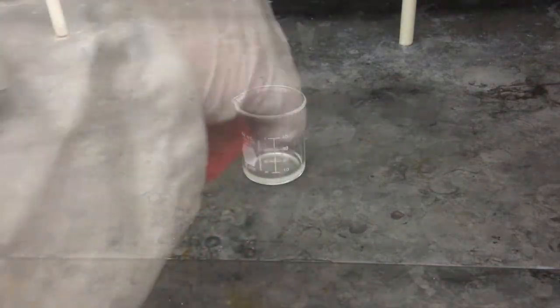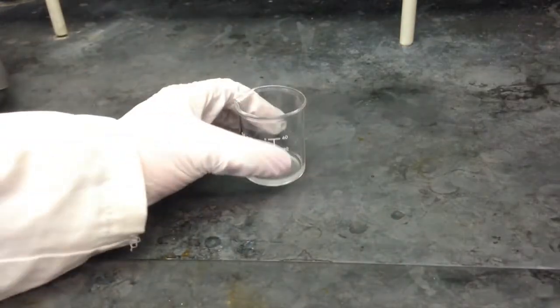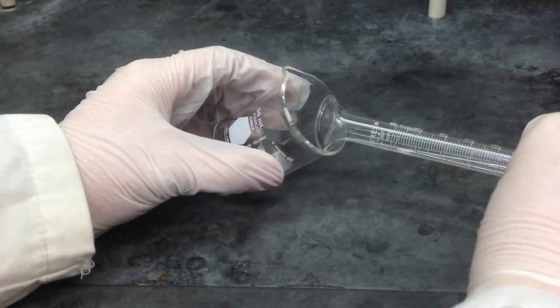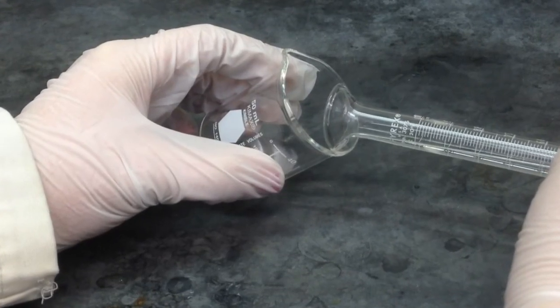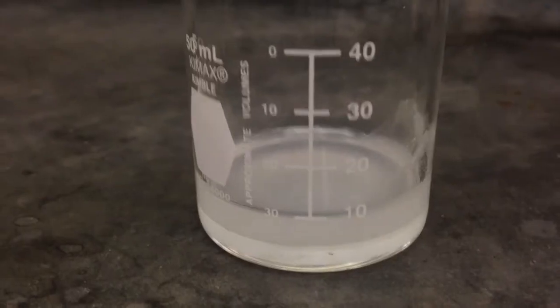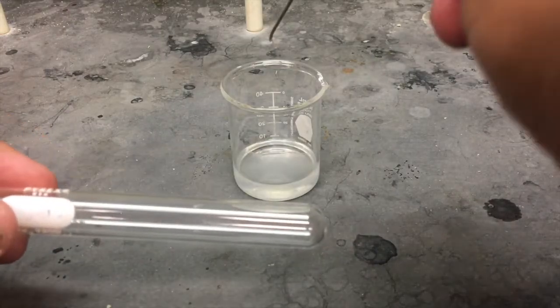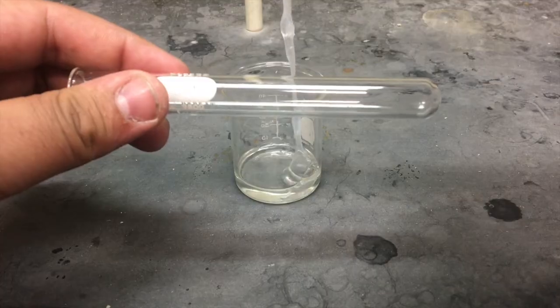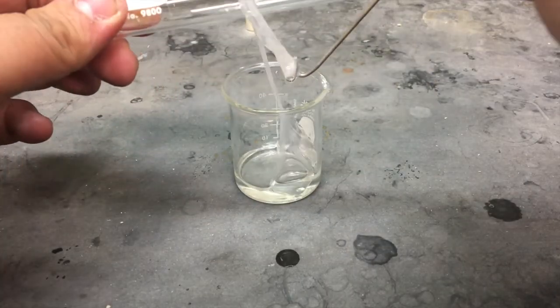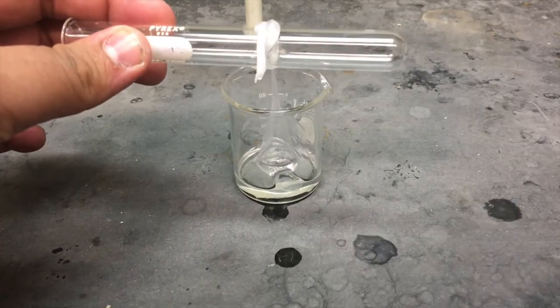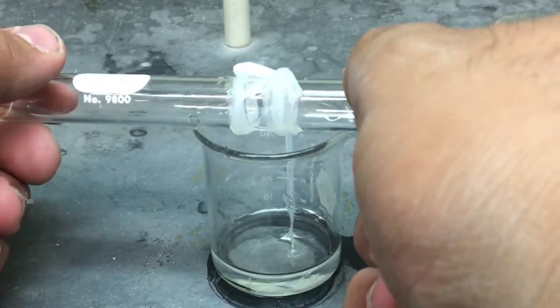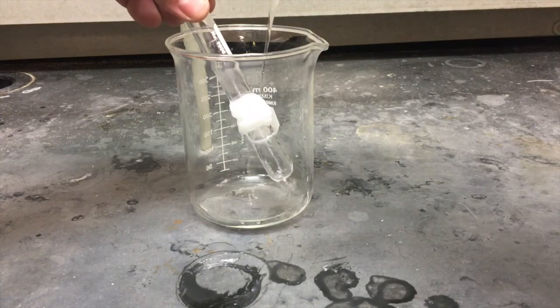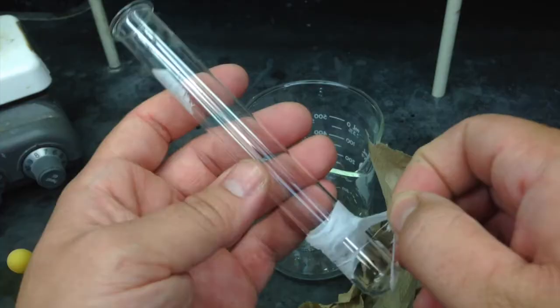Pour your diamine into your 50 ml beaker. Then after you get your sebacoyl chloride, tilt your beaker at a 45 degree angle and pour the sebacoyl chloride down the side of the beaker so that it forms two layers. Nice and slowly. This is just like when you pour a beer so you don't get too much head. It's the same exact technique. Once you have the two layers, grab yourself another test tube and a hook. Drag the bottom of the container and see if you can grab a hold of the nylon. Then loop it around the test tube. Once you have it hooked on, wind the test tube slowly to remove the polymer. The polymer is actually being generated as you are pulling it out so you can't go too fast. That being said this does take a while so here's a sped up version. Once you're done with that, rinse the polymer with a little bit of 50% ethanol. After that, you can play with it as you wish.